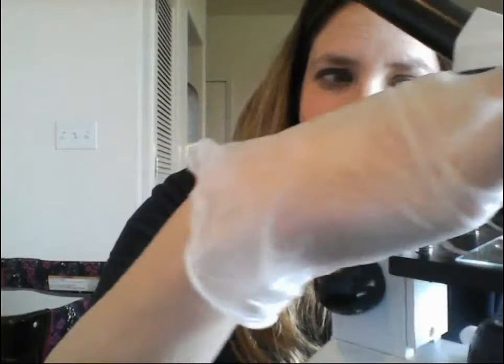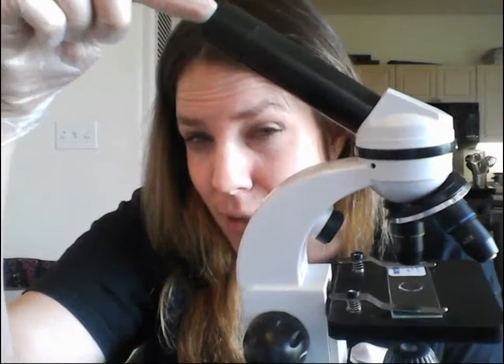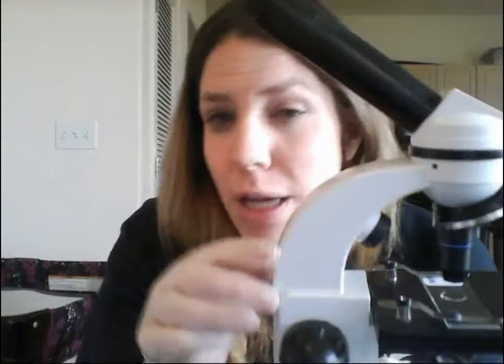Quick quiz: what is the total magnification of the red 4x objective? 4 times 10 is 40 total magnification. The yellow 10x objective: 10 times 10, so 100 total magnification. And the blue 40x one: 40 times 10, so 400 total magnification. That means your specimen looks 400 times bigger than it really is. Amazing — that's a lot.